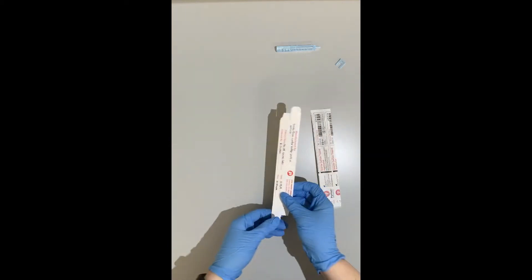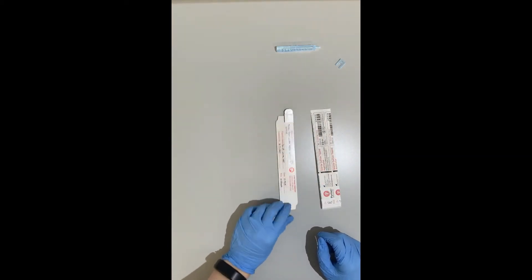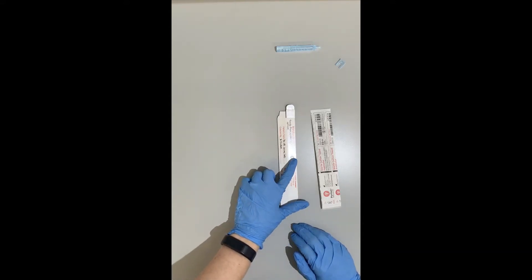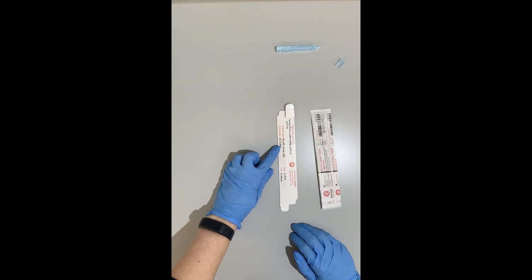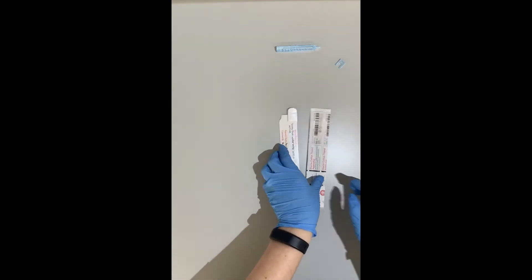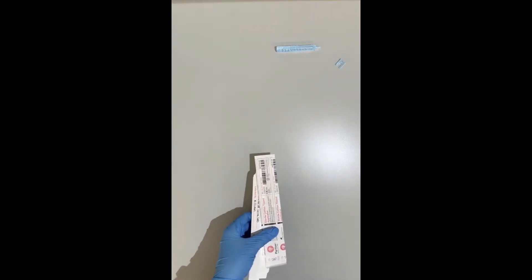We also will need a swab carton. I have pre-labeled my swab carton before I've started my collection with the location of the swab, the victim, who collected it, the date and time.